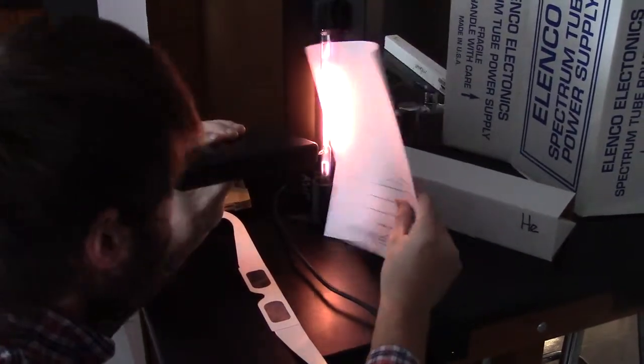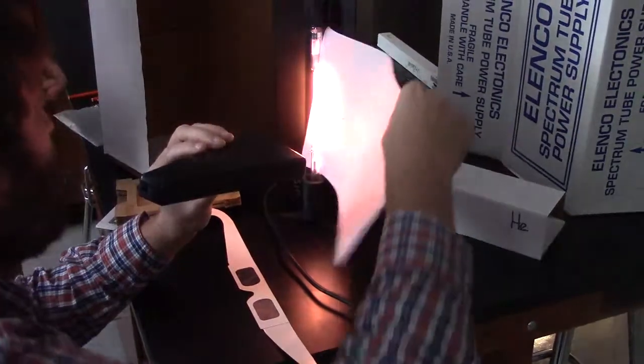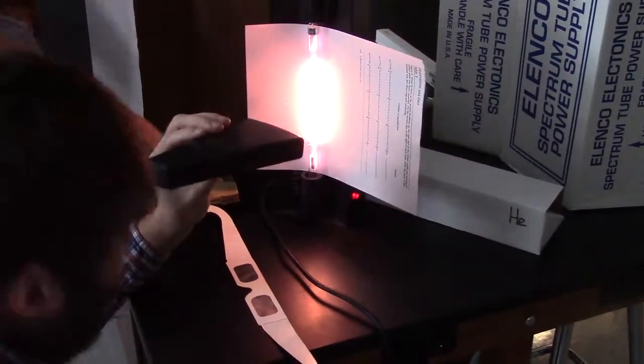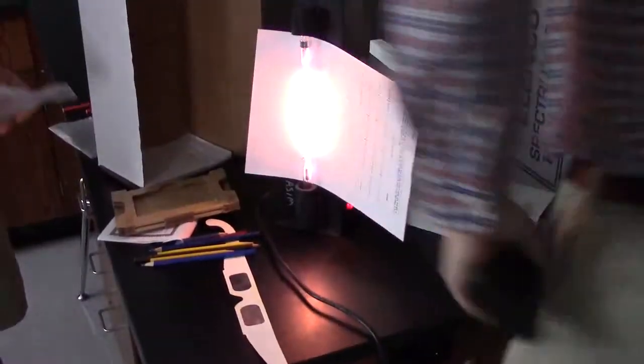I have no idea if this will actually work, I'm going to actually slide my sheet of paper just like that. Oh my goodness, game changer. Well guess what, we're probably going to need another data table now. Hey Sam, where's another data table? You can have that one since you wrote on it. I'm going to slide this little sheet of paper right here to give me a little background. And now let's see if we can do this.